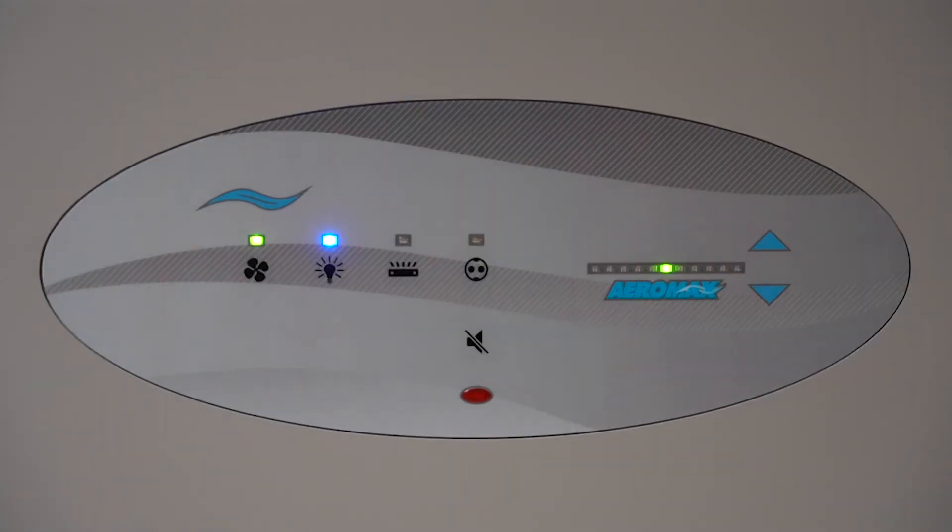The series of lights represents airflow performance. A green light in the center indicates airflow is normal. A red light on the left or right edge indicates incorrect airflow and will activate an alarm.